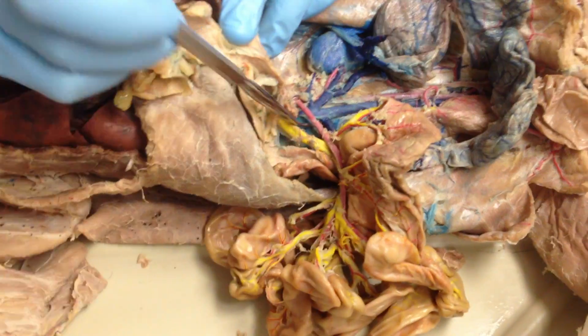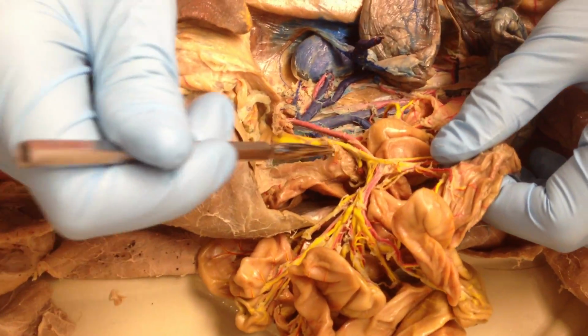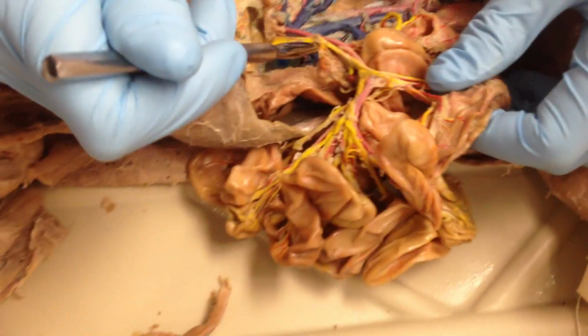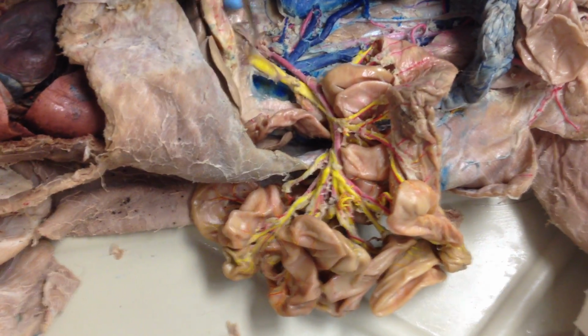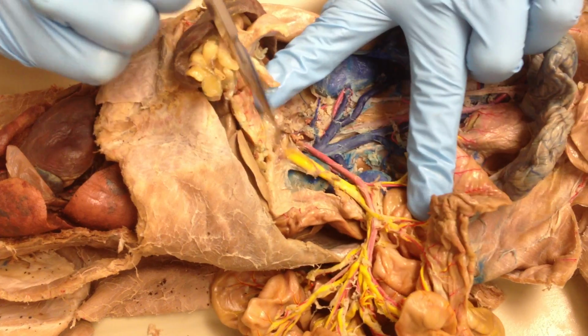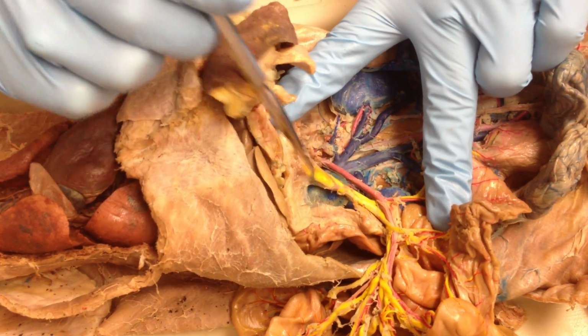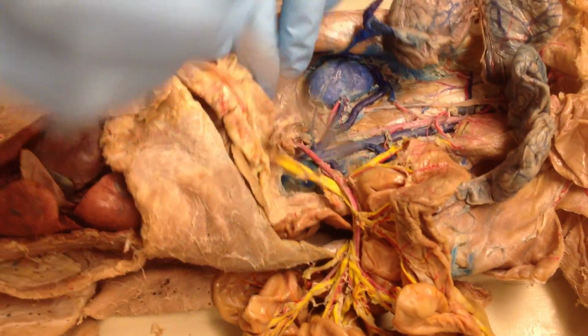Okay, so back to the intestinal system. So we talked about the superior mesenteric artery here. You have a superior mesenteric vein as well. They come together. However, the superior mesenteric vein, if we tag it way up at the top here, this is going to be hepatic portal. It's pretty short, but we would delineate, way up here versus way down here for the superior mesenteric vein. So together, that's superior mesenteric.